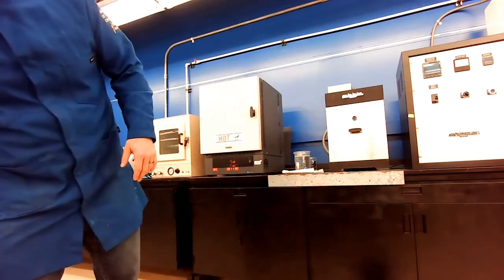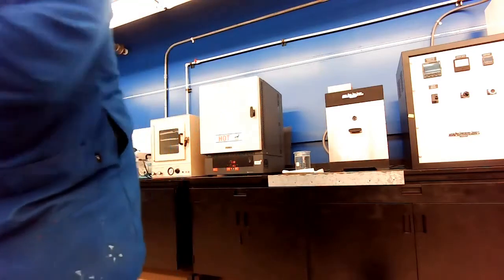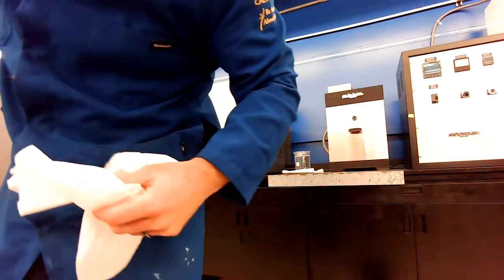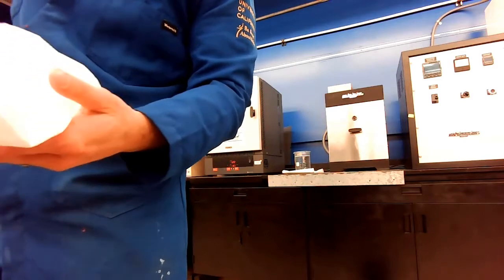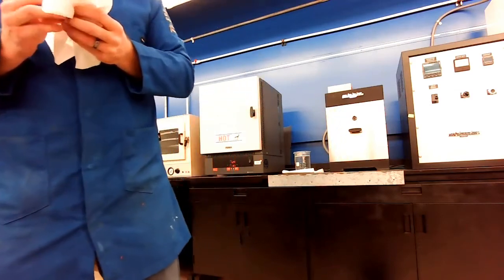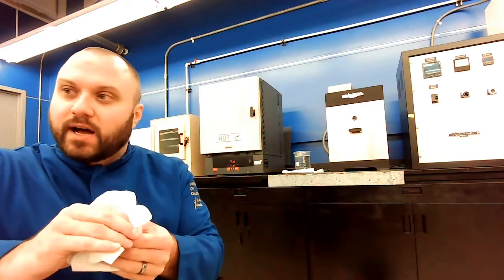I just had a second water beaker back here. These things are cooled down. They're not hot anymore. There's nothing dangerous about them. I just want to make sure I'm getting all that salt water off. So I'm going to pull these out and dry off one. One thing that happened is when I put this thing in this cool saltwater bath, it very rapidly quenched down.